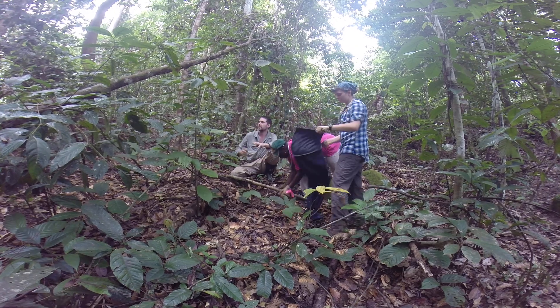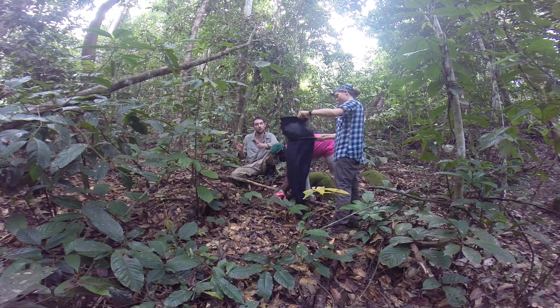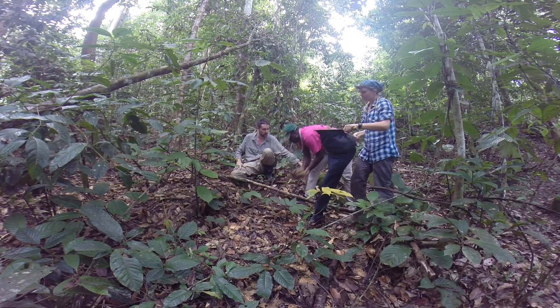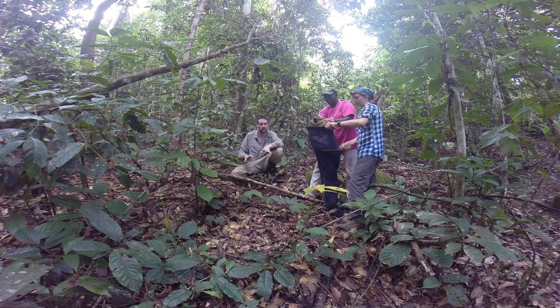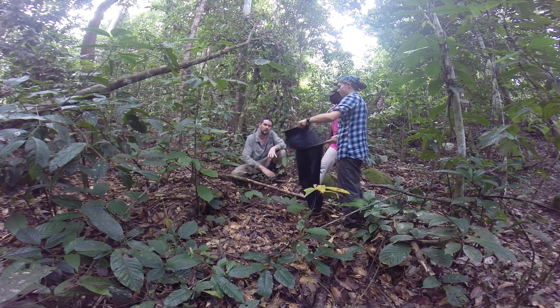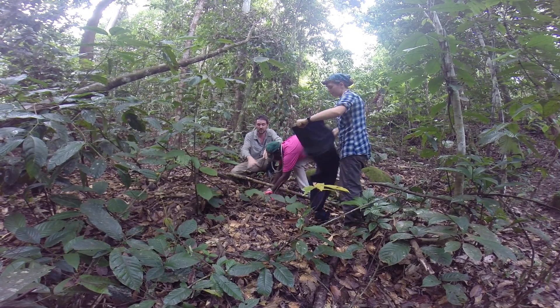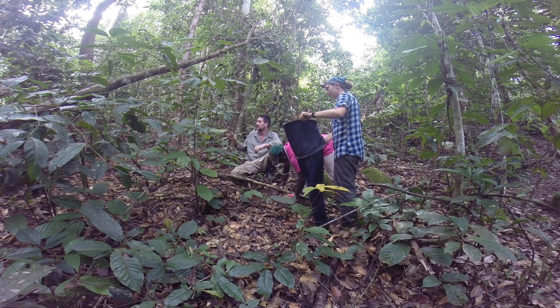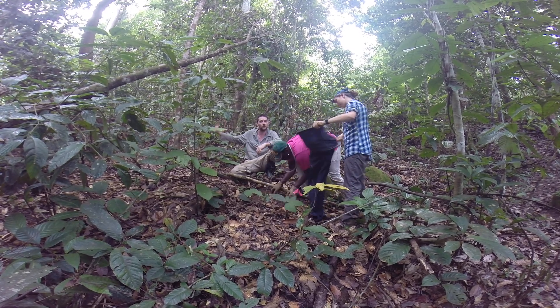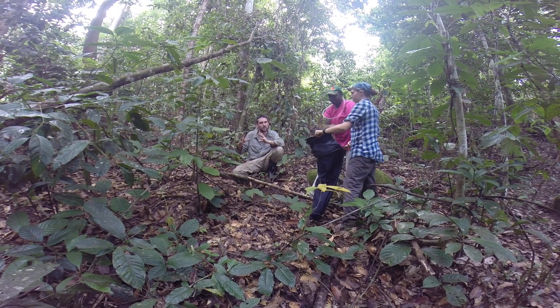We're going to do that for a few different sites, just to be sure we catch ants from different micro habitats. Here we do it near a rock — there's a bit of decaying wood nearby — those are usually good sites for ants to nest, as most foragers living in those sites might be foraging in this area. We're also going to try at the base of large trees, which usually accumulate a lot of leaf litter and have very good moisture conditions.